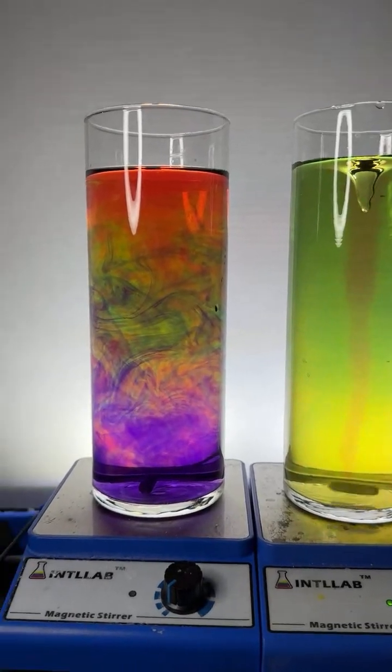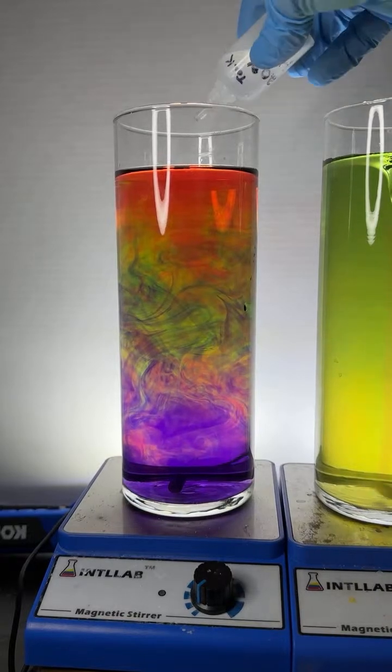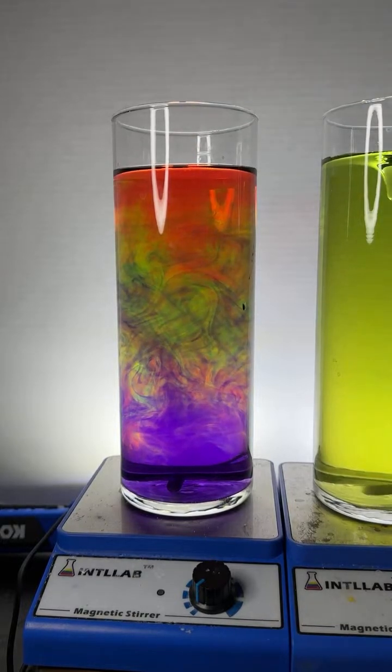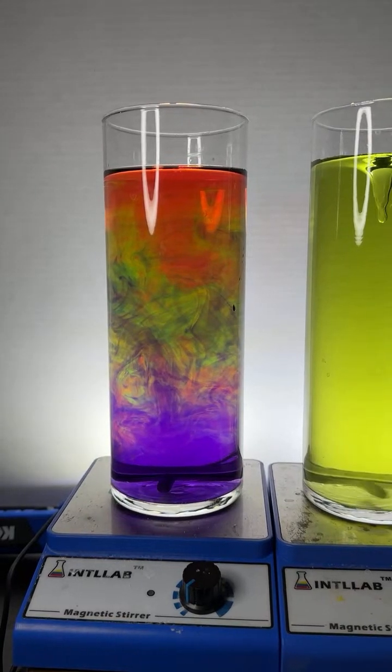That is gorgeous. Boy, is that really pretty over there. Just chase it with a bit of acid. We're running low on acids. I'm going to just put a little drop of acid in here, get a little redness going in. A little bit. Very pretty.